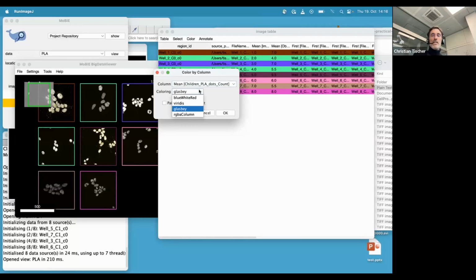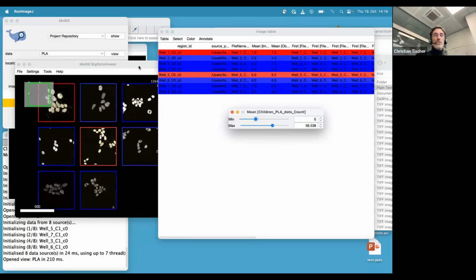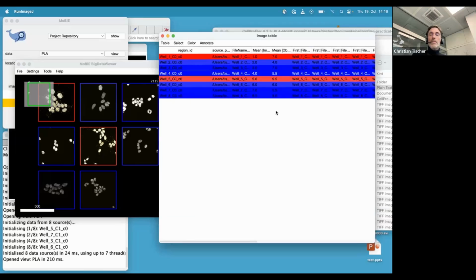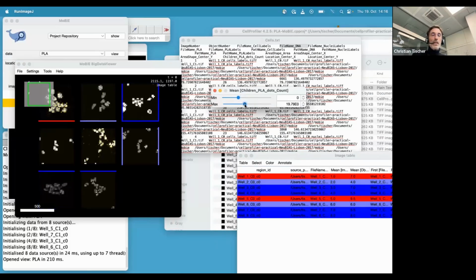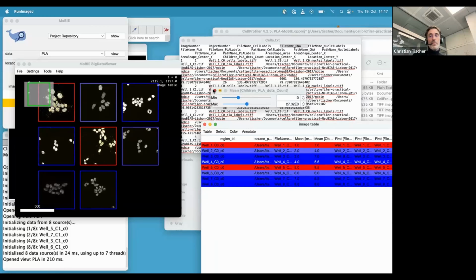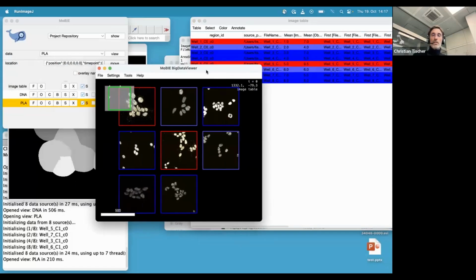So we can color by this, and here I usually use the blue, white, red. So red is a lot, blue is very little. And then you can already here conveniently see which images had most spots. Yeah, so this can be useful. And you can adjust the lookup table here to have maybe more fine-grained coloring for also some that have just a few spots.